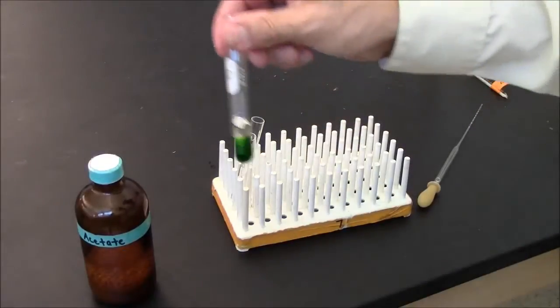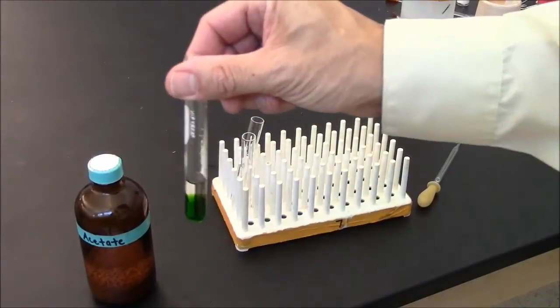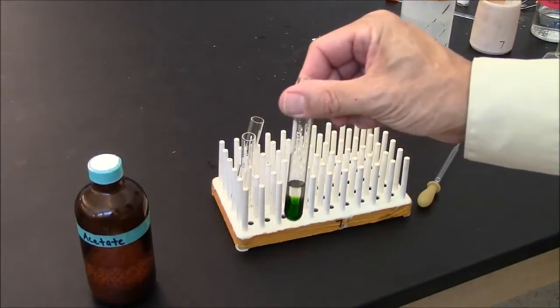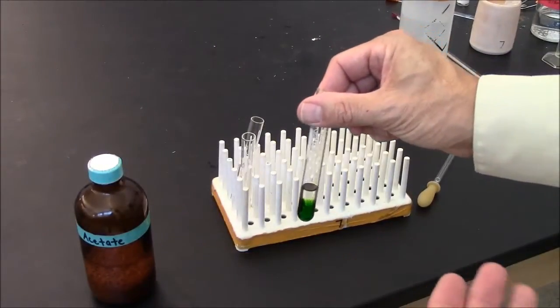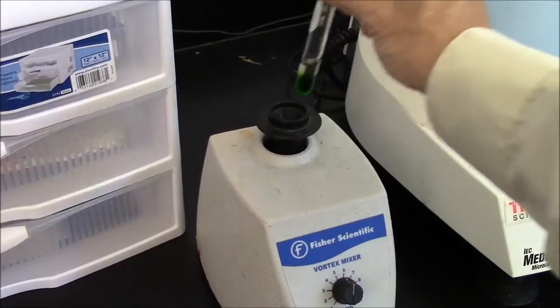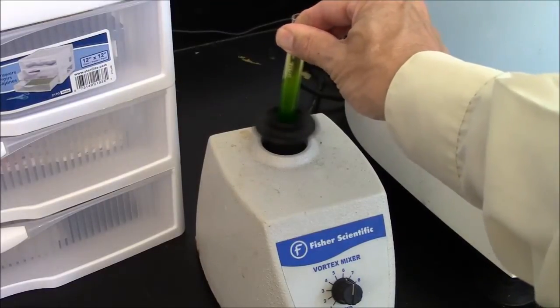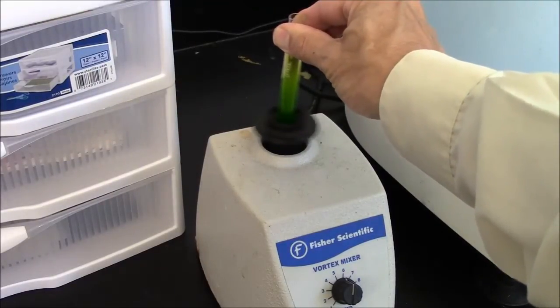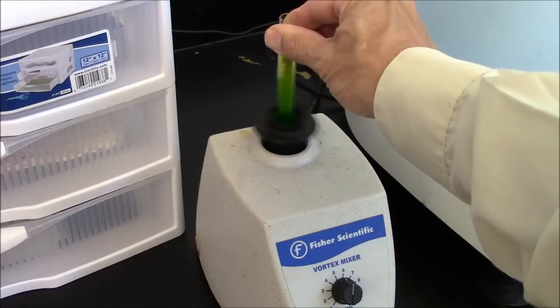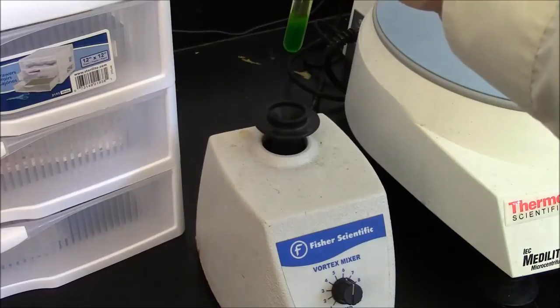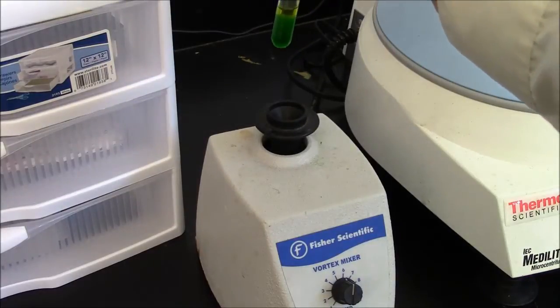So now you can see the ethyl acetate is not miscible with the aqueous layer. To get an effective extraction, I'll vortex this. So as I'm vortexing, the solvent layers are mixing, and anything that can dissolve in the organic layer will dissolve in the organic layer.